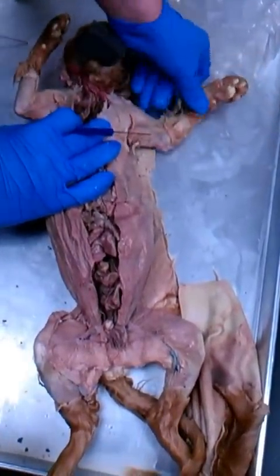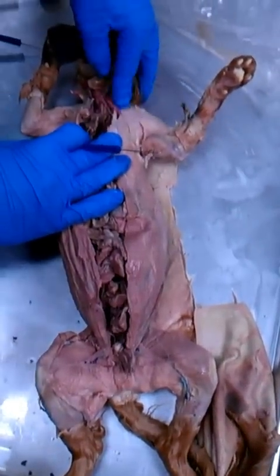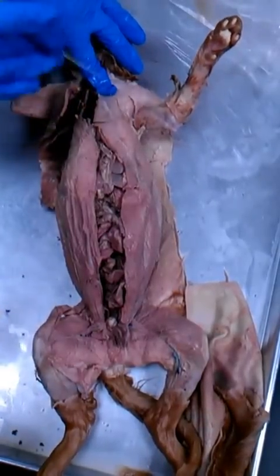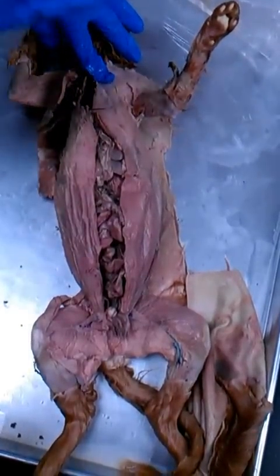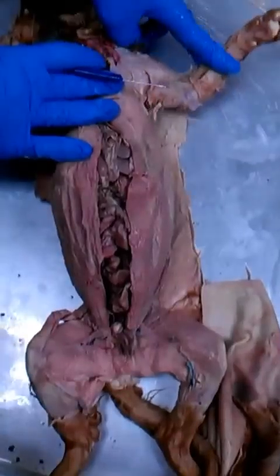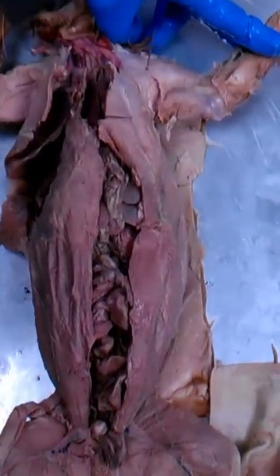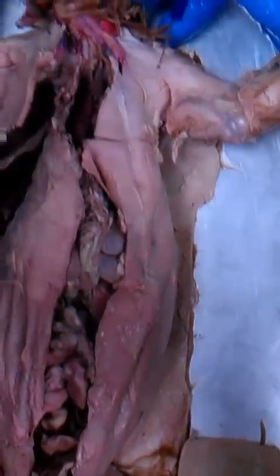We have our pectoralis muscle. We have two of them up here, the pectoralis major and the pectoralis minor. The difference with these two is the direction that the fibers are running. If I stretch this guy out a little bit, you can see that there are fibers that run basically straight across here. Those right there will be the pectoralis major.